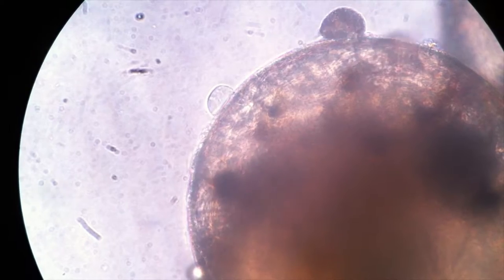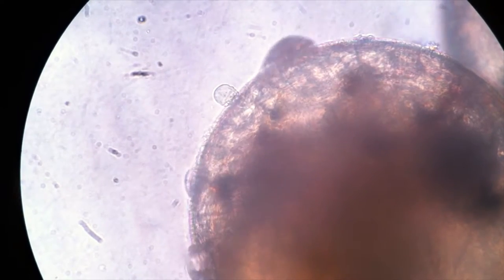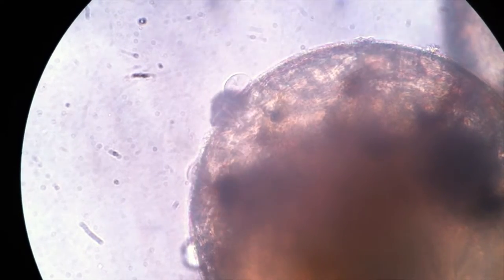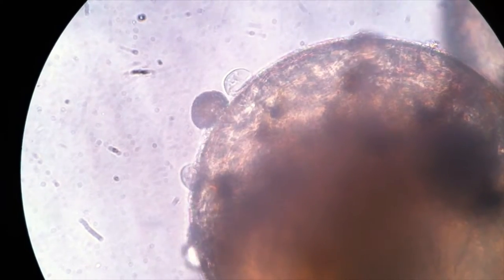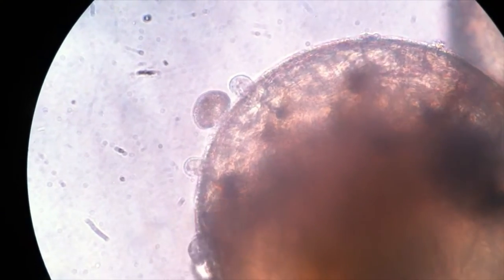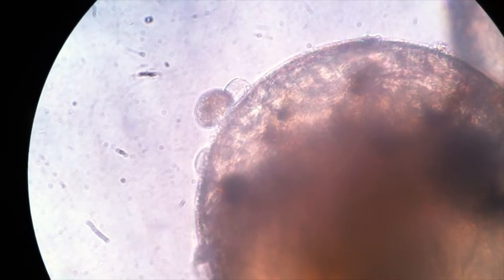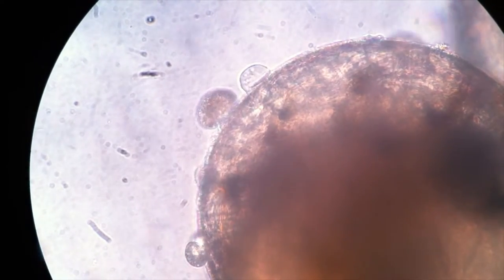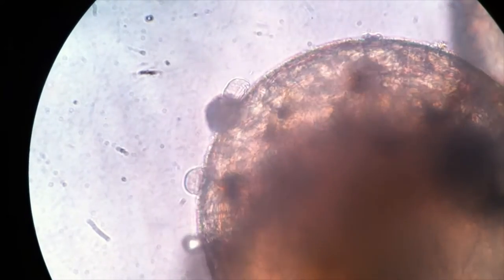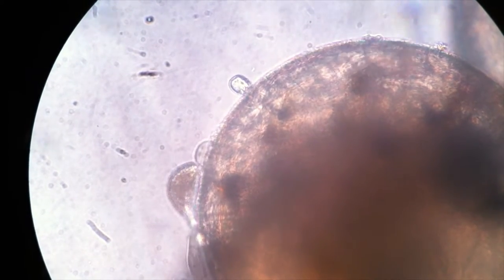And of course we've got a close-up of the ciliates crawling around on the egg, which is always fun to watch — how these microscopic organisms move around. You watch this kind of stuff and you just wonder, what are they doing? It's just such a strange world.